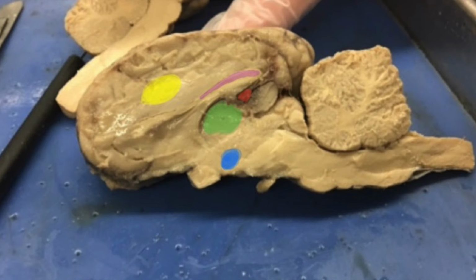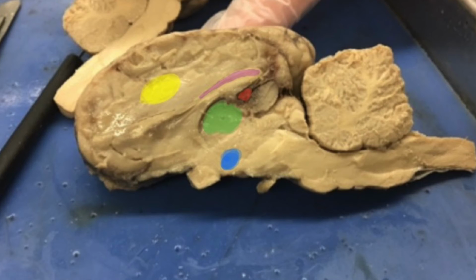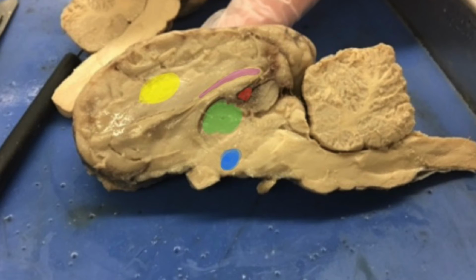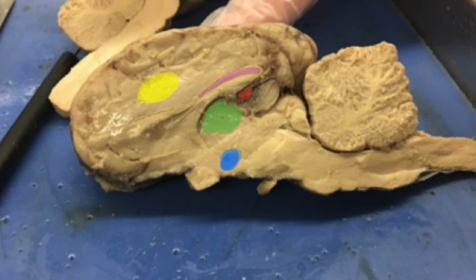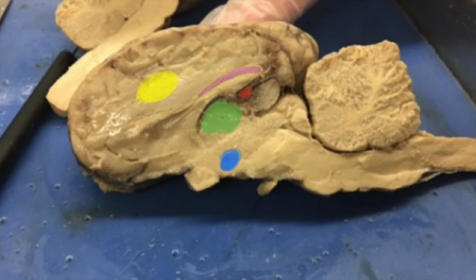Under the hippocampus, in green, is the thalamus. The thalamus is located near the brainstem, but also has a pretty central location in the brain itself, and therefore plays a large role in the transfer of information between the body and the different cortical structures around the brain. Lastly, on this photograph, near the bottom middle portion of the brain, highlighted in blue, is the hypothalamus. It is located between the temporal and frontal lobes for proper regulation of necessary bodily functions. The hypothalamus regulates important functions like hunger, thirst, and arousal, as well as plays a part in controlling body temperature.